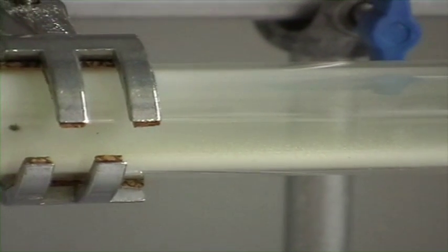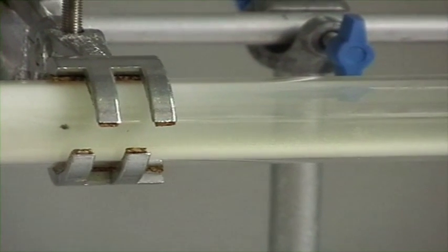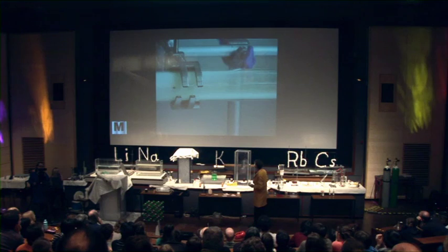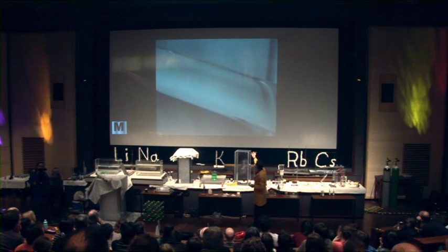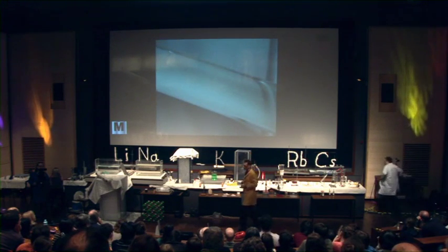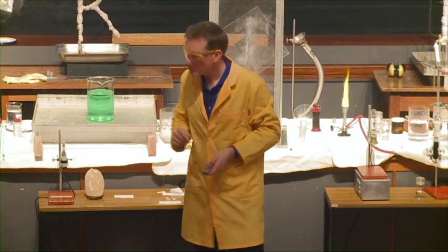We can see this in this last shot here. The sodium chloride — this is just our normal salt that we would have on our chips. Crystals of salt formed from the reaction between sodium and chlorine.